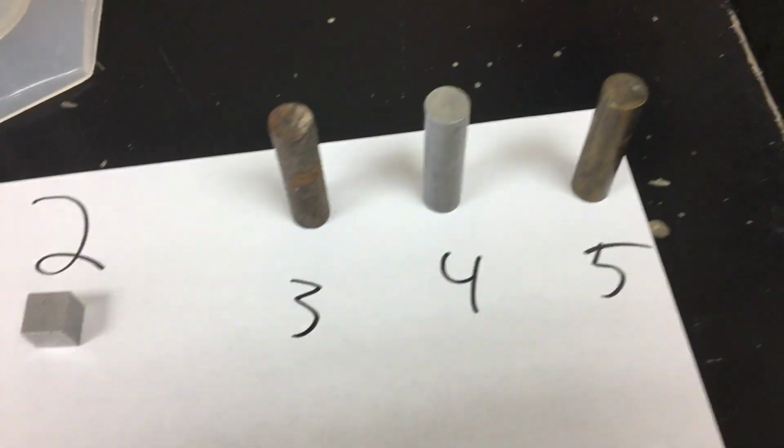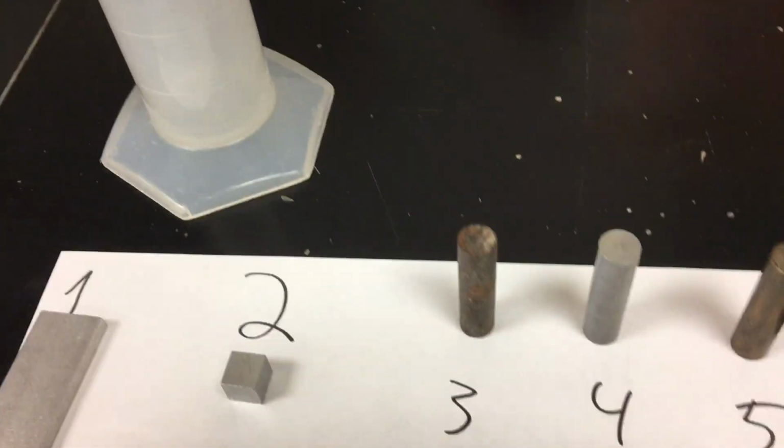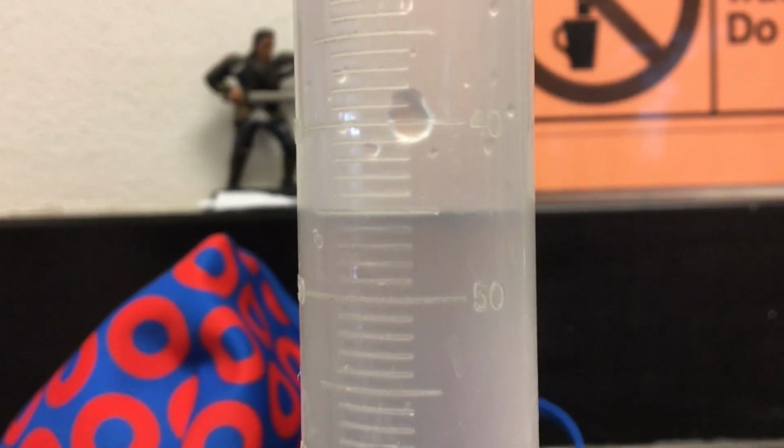All right, now we're going to move into these cylinders. Now the trick with these, there's not a formula for the volume of a cylinder. There is, but we're going to do the displacement method, which maybe we know, where you chuck some water in there. It doesn't really matter how much. Let's see what I got. Looks like I'm going to give it one more drip there, get it off the line.